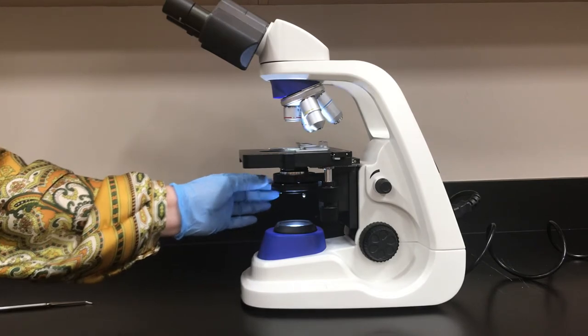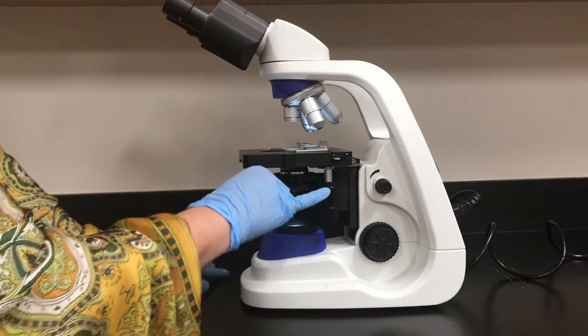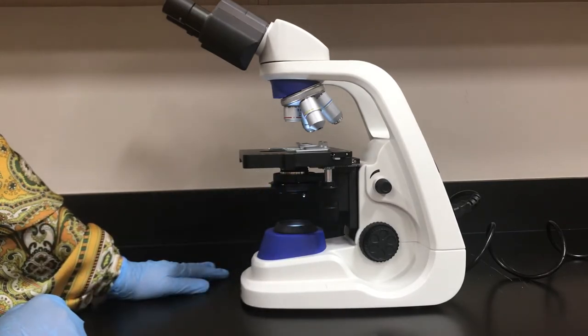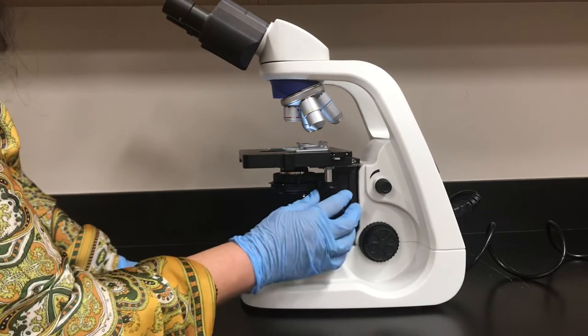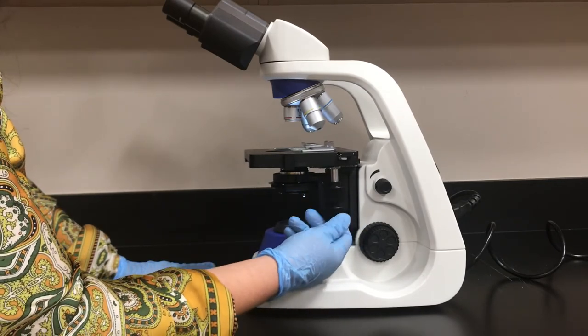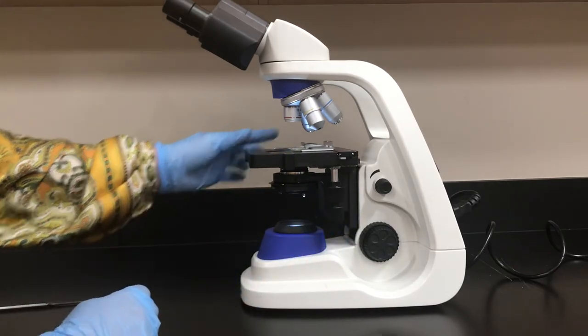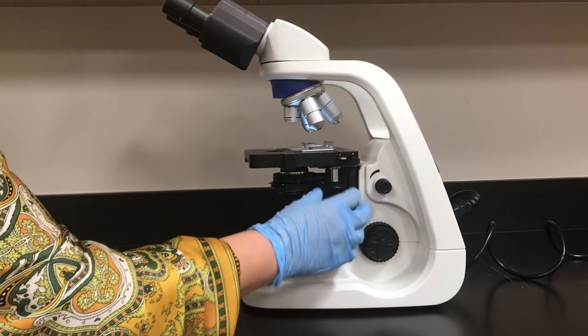I want to show you two more stage adjustment knobs. This stage adjustment knob allows the stage to go forward and backward, and this one allows you to go right to left. You do not try to move by hand, but you use your stage adjustment knobs.